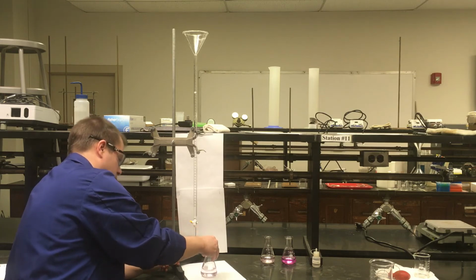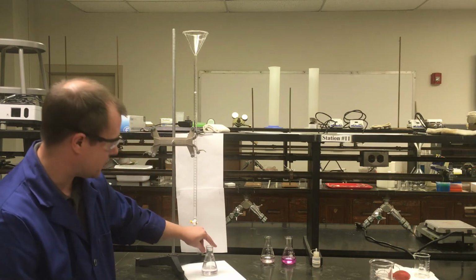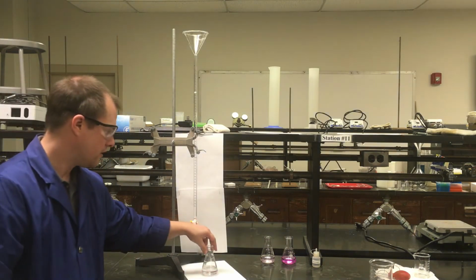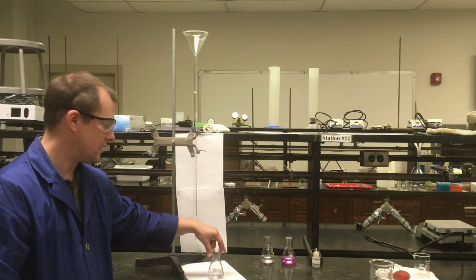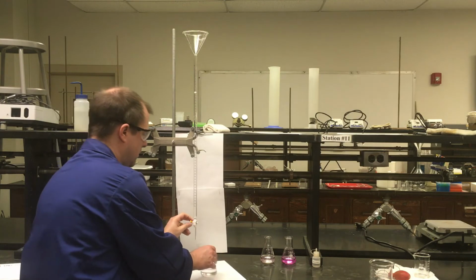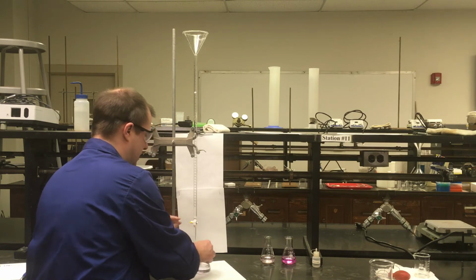And there, after a few swirls, you might actually already be able to see, it might be a little hard in the video, from here it looks like there's a tiny, tiny tinge of a pink color. Although once I've stirred it and let it sit for a minute, it didn't quite stick around. So I should be really, really close at this point. I can try to get just one more drop and see if that's all it takes to get us to a stable pink color that will stay.